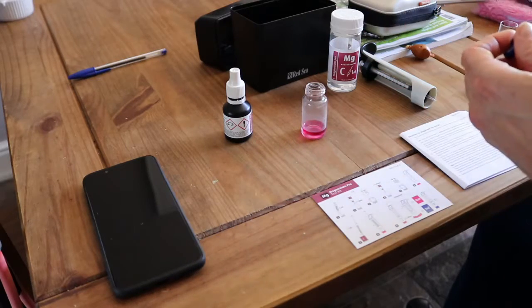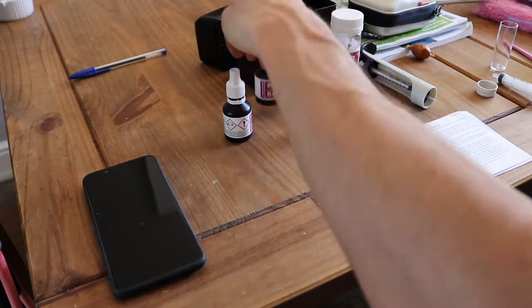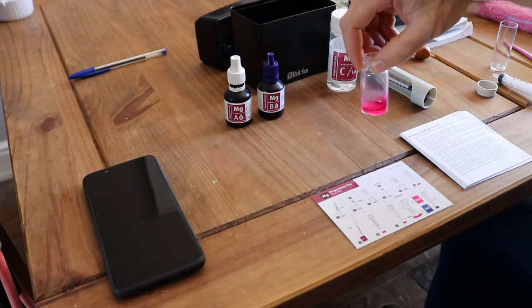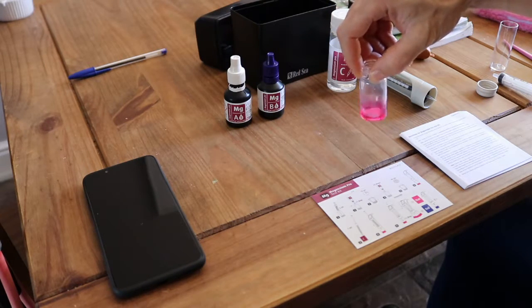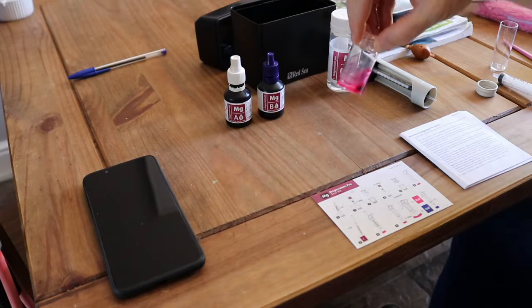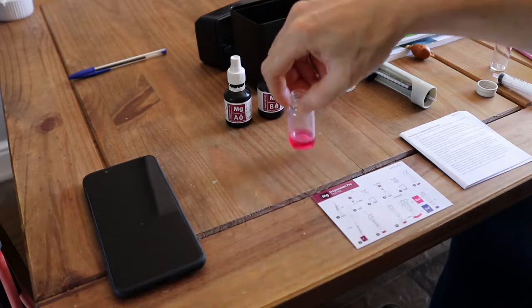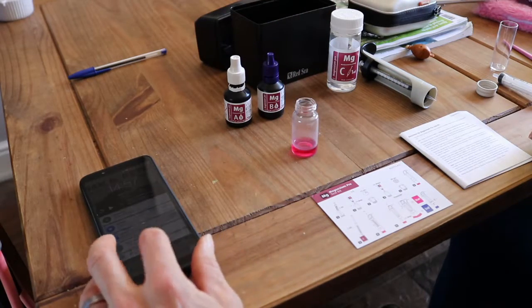1, 2, 3, 4, 5. So, again, this is where the instructions are rather ambiguous, because you do not stir or shake for 60 seconds like the card says. Red Sea confirm, you just give it a mix. That's probably a pretty good mix. And then you leave it for 60 seconds.